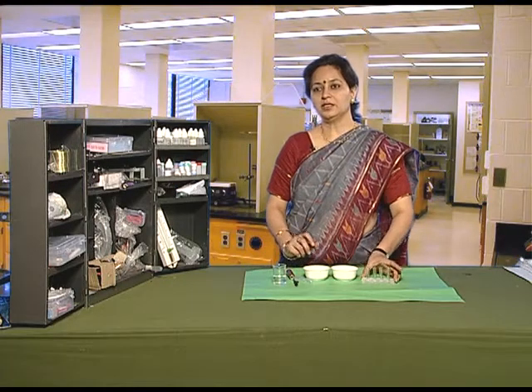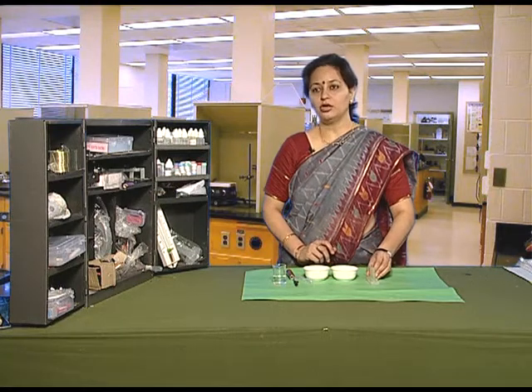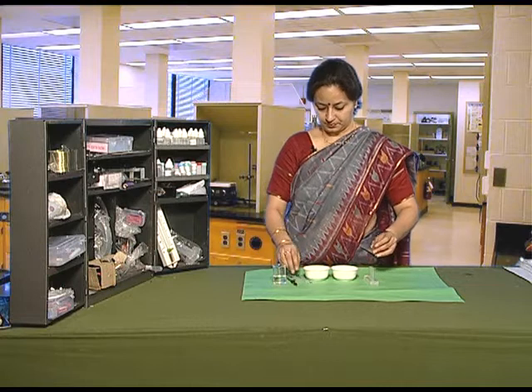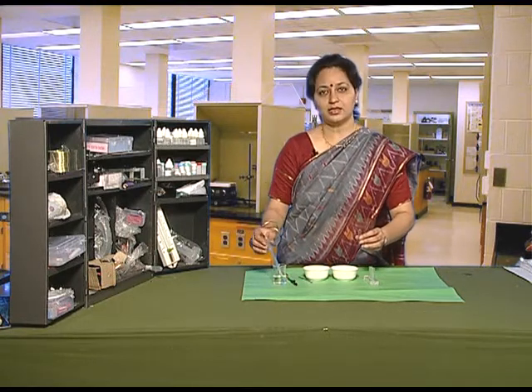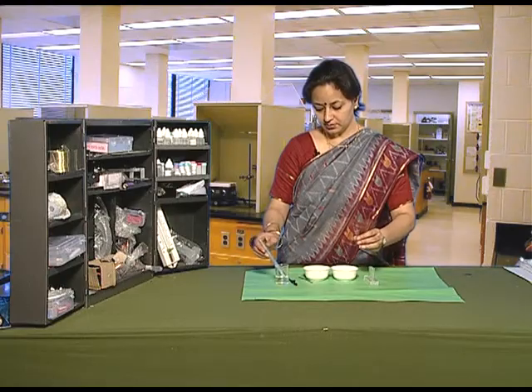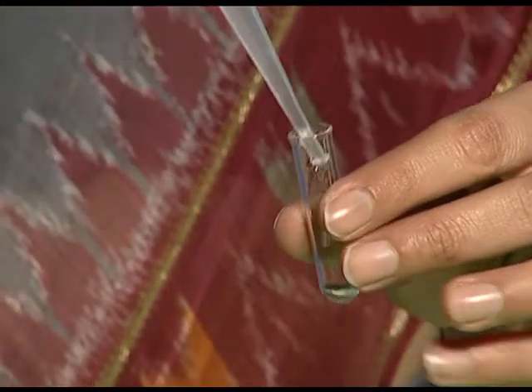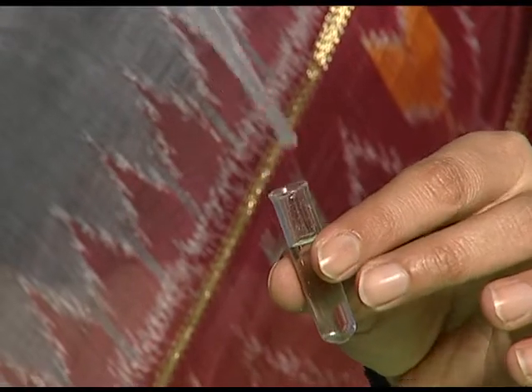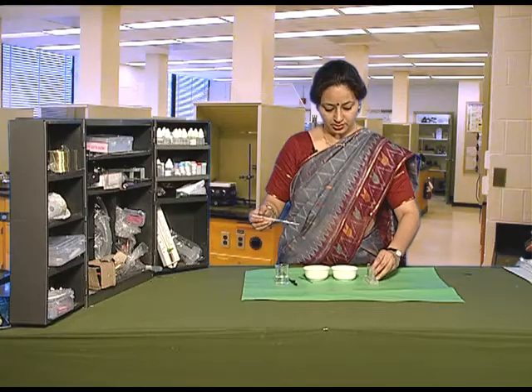We'll take a known volume of water in two test tubes — let's say one ml — and in both test tubes we'll take the same quantity of water.